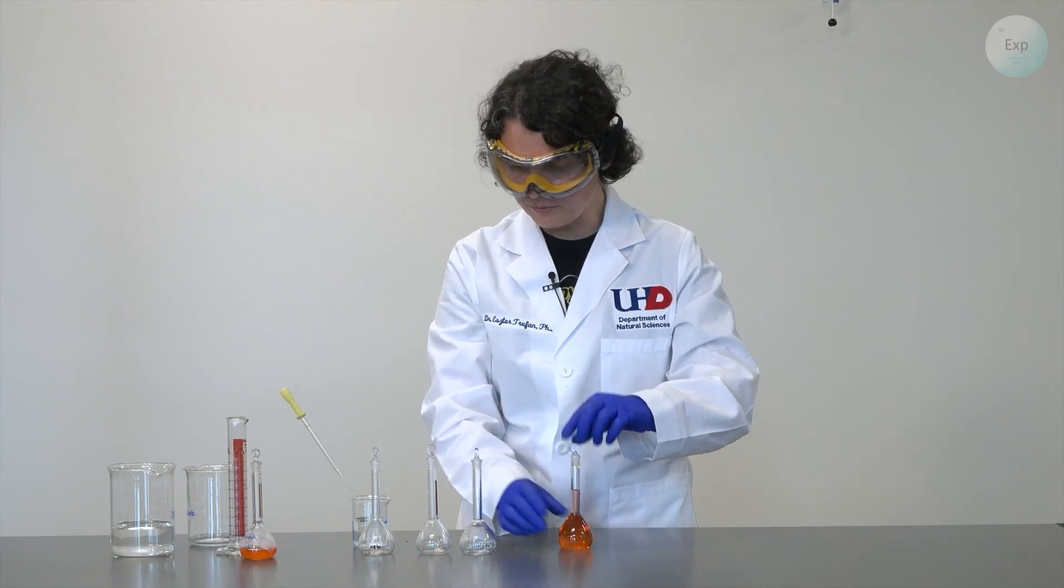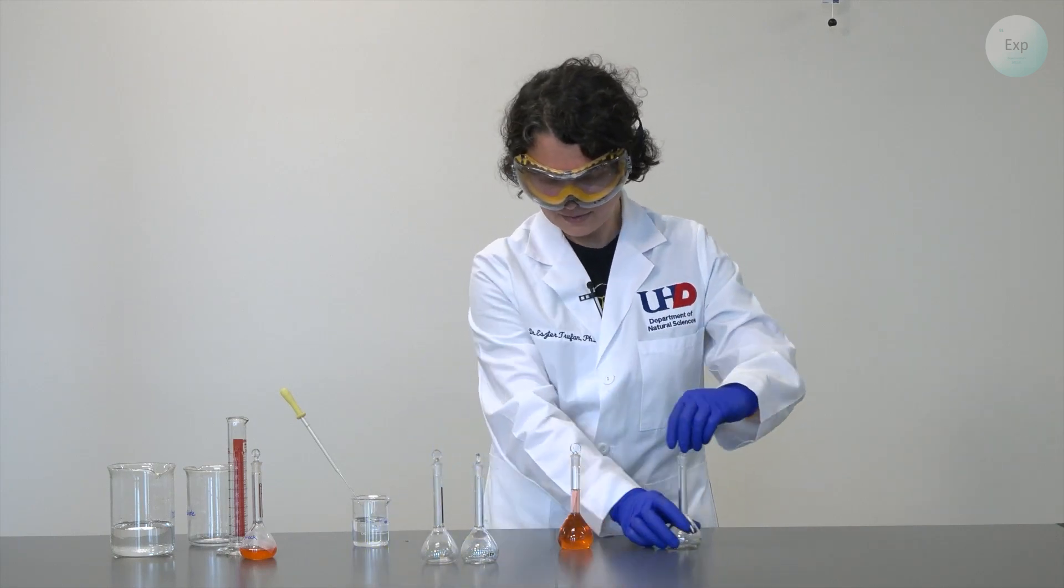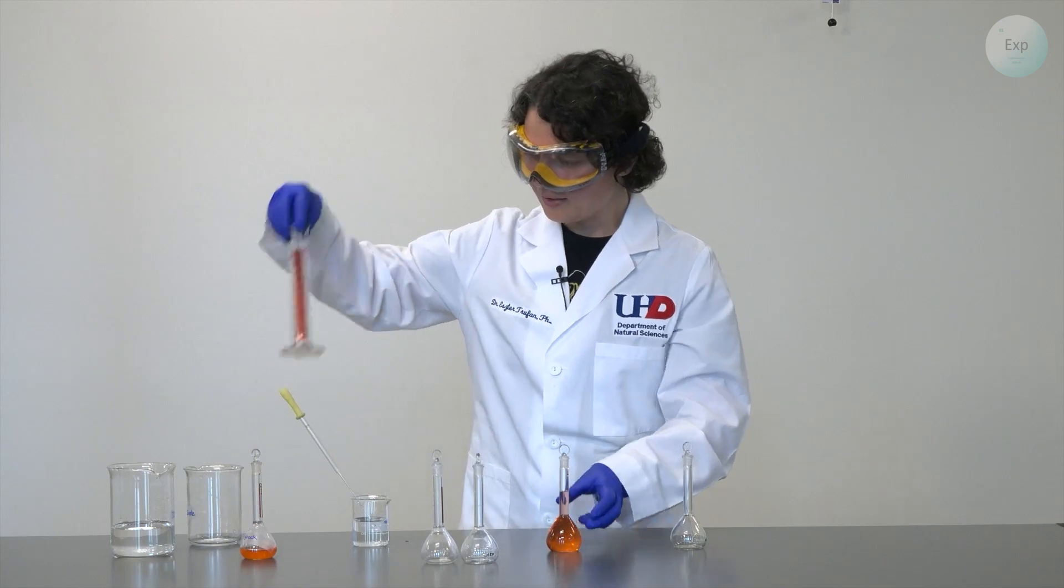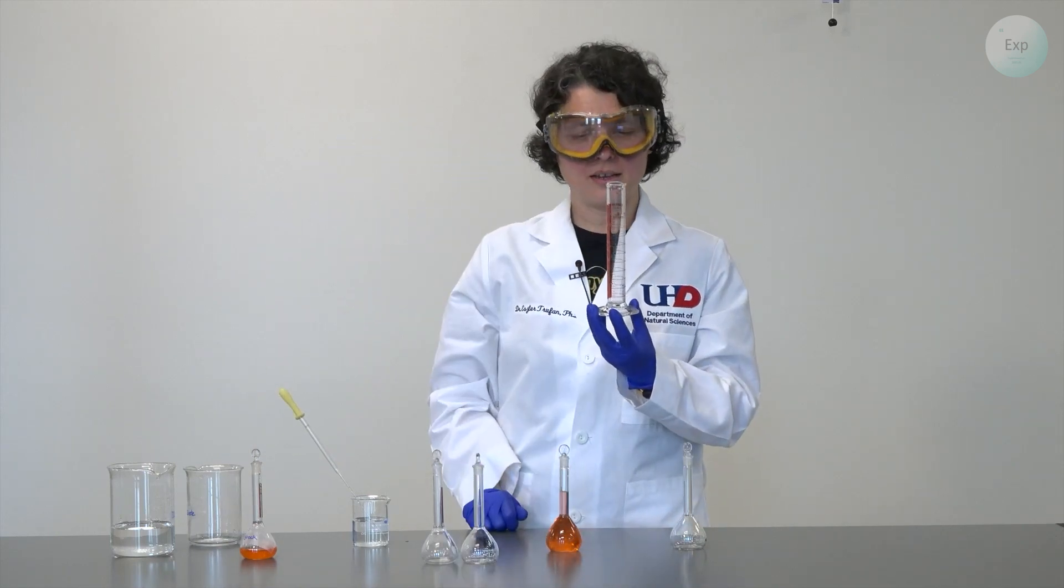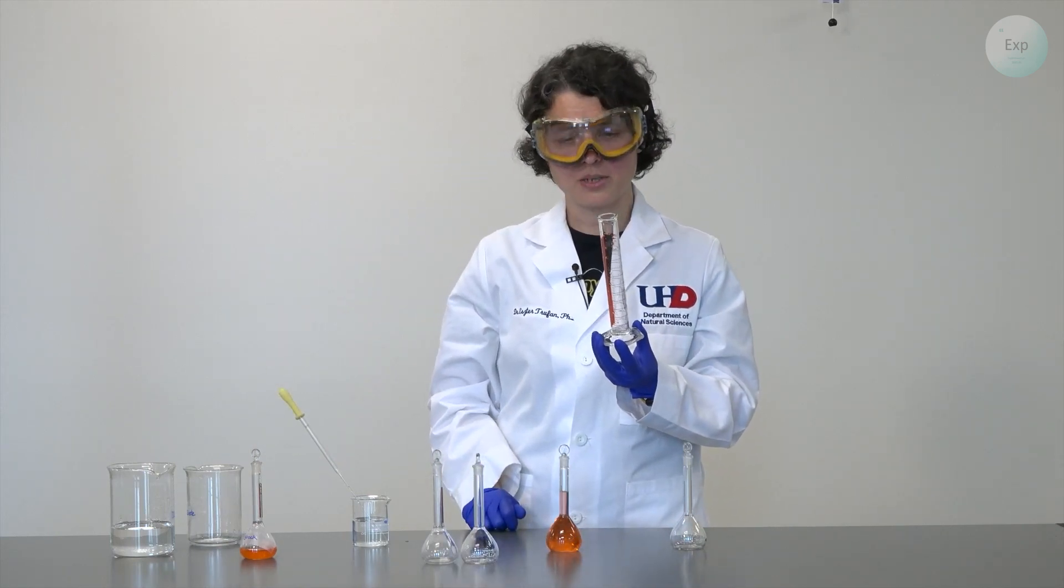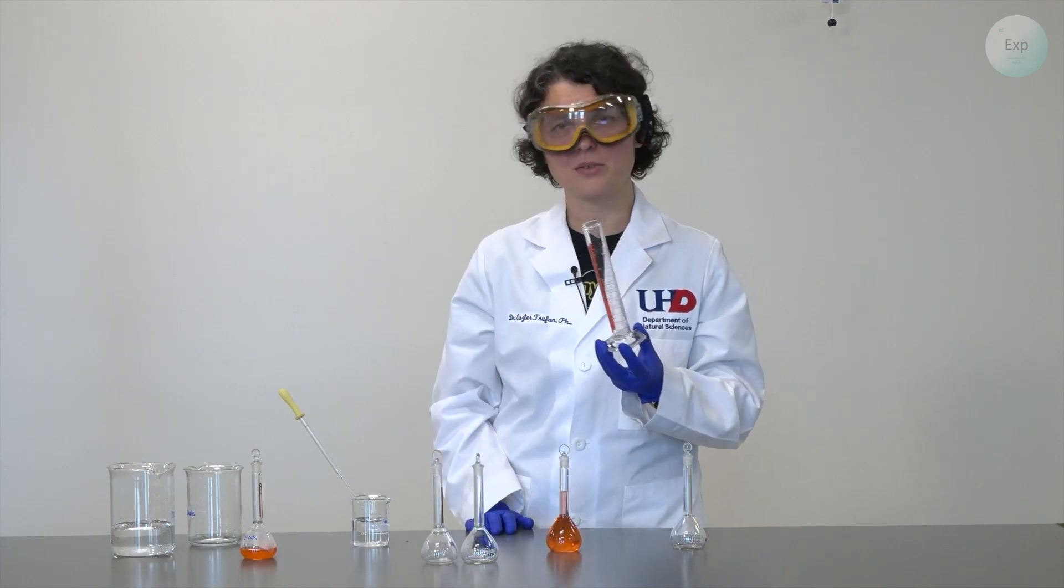And I am ready for the next step in the dilution. Next, it will be useful if you dry your graduated cylinder in between measurements. So that is what I'm going to do now.